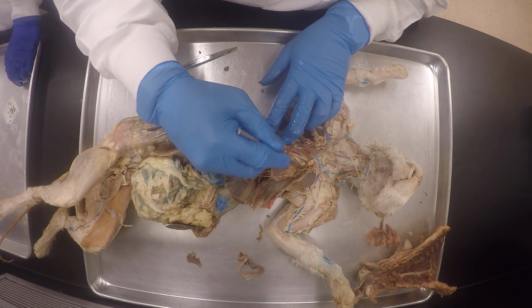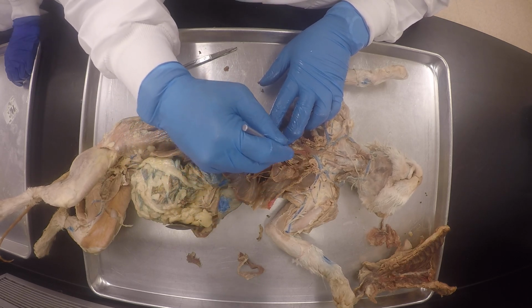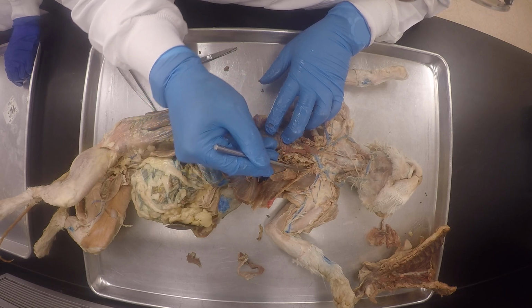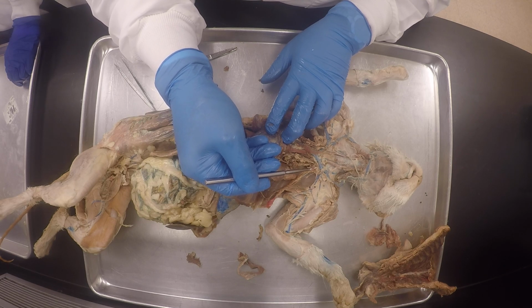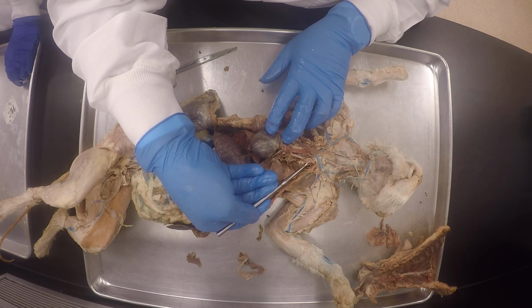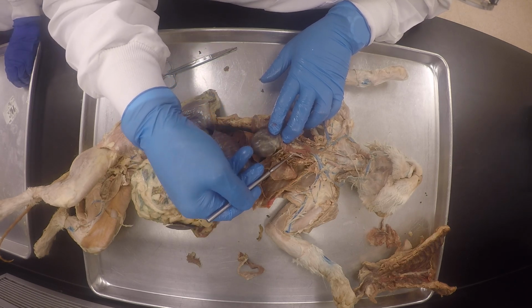Gets a little messy. And then being left subclavian artery. I just have to clean it a little bit. And then, of course, the internal mammary artery. You see here? Do you see that? Oh, that little one? Yeah, this is the internal, because it's coming from the left subclavian artery. Do you see it? This is the left subclavian artery.